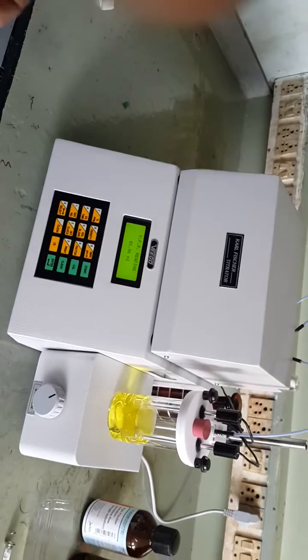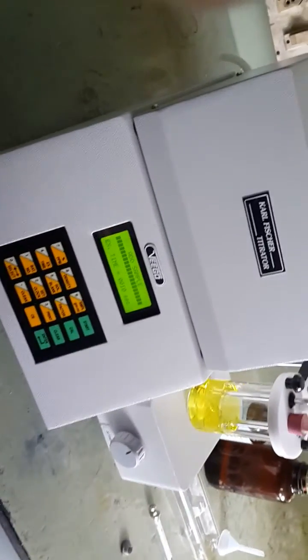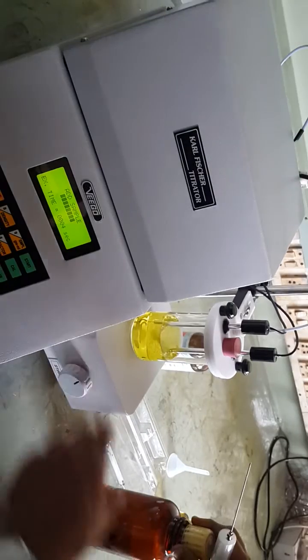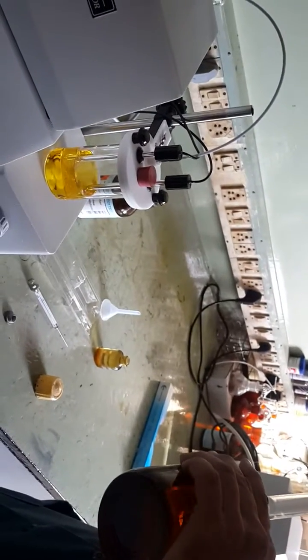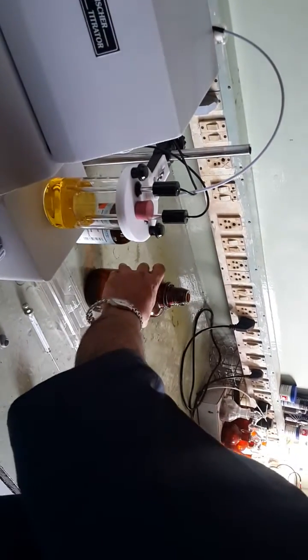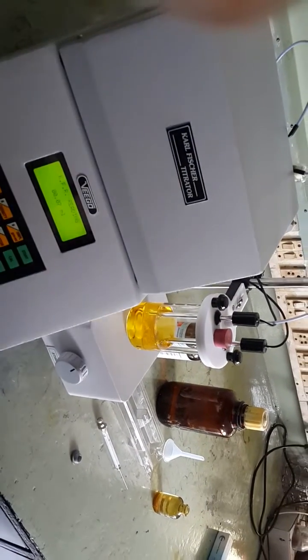Now we will add a liquid sample. Before adding the sample, press the start key to ensure the endpoint — you should not spend time between two titrations. Press the start key; depending on the time elapsed, some reagent addition will take place, which we will discard. The reading of 0.07 will be discarded. Now prepare 10 ml of methanol as the liquid sample.